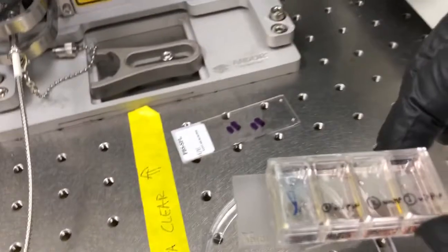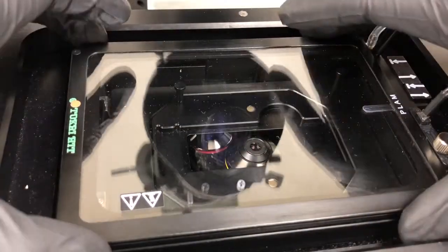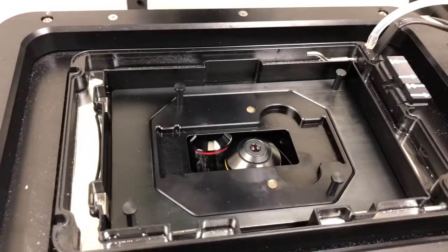So let's go ahead and put this on the microscope. I'm going to remove this cover so that we can place the sample.